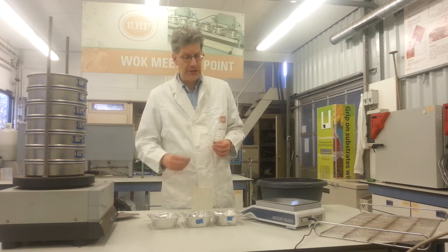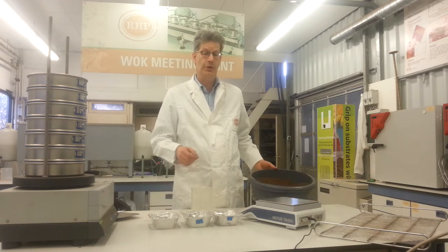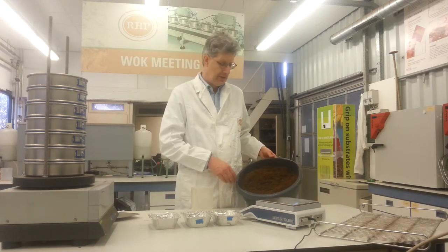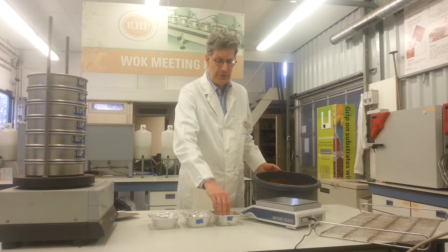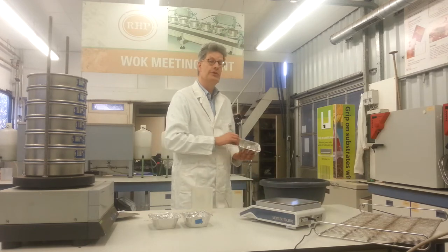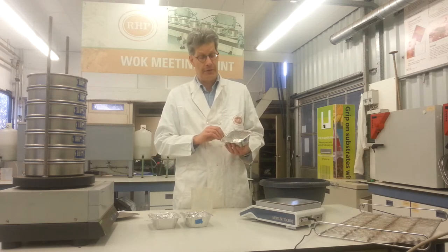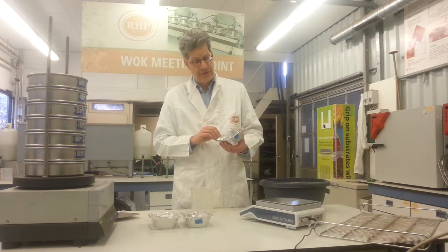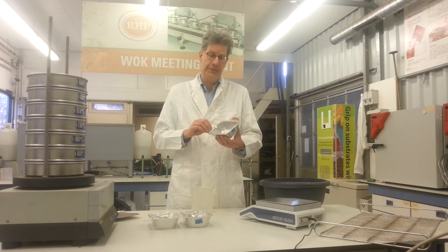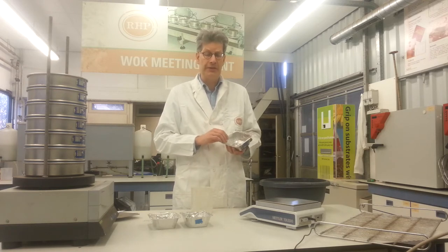The first step in principle is to dry the peat material, because we screen peat air-dried. That means we take a subsample, put it in an aluminium tray, and dry it in the stove for a few days. It takes at least 48 hours, preferably 3 days, so you can do it over a weekend for instance. And you do it at 40 degrees centigrade.